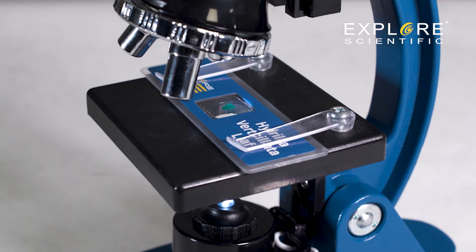With the light on and a specimen in place, look into the eyepiece. You should see a white circle of light. You might see some dark splotches or lines. Don't worry. This is normal.